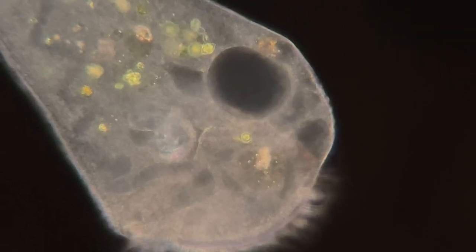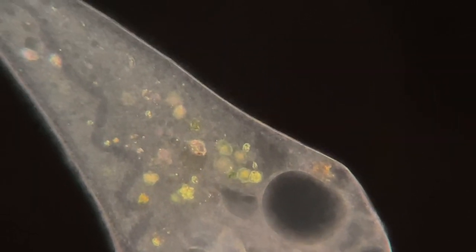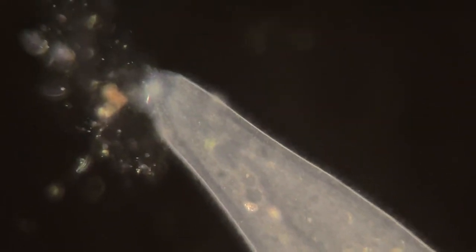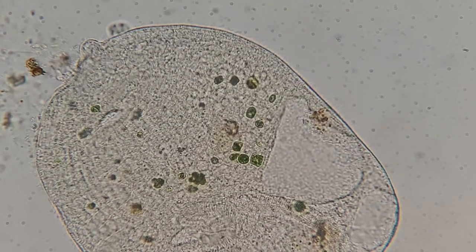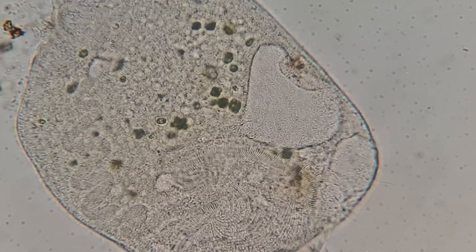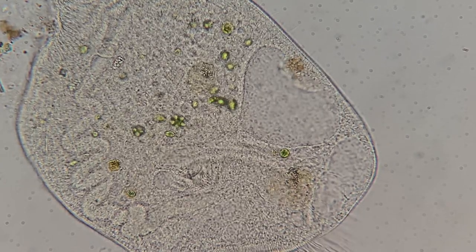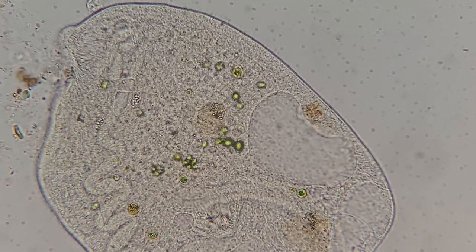They have a macronucleus which serves as the brain. Now this particular stentor was a little bit sliced at its base — I might have done this on accident when putting it under the microscope slide. Sometimes it happens, but one of the cool things about stentors is that they can survive small cuts like that. They can close themselves up and keep growing, and here it has shrunk back. This is one of their defense mechanisms — when they feel threatened, they shrink back, and then eventually grow out into their long trumpet shape.